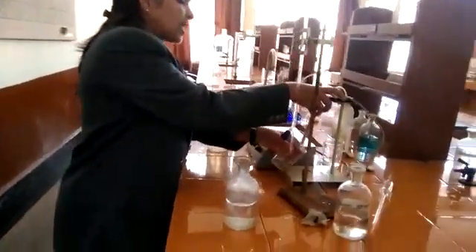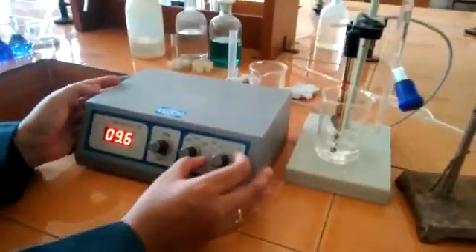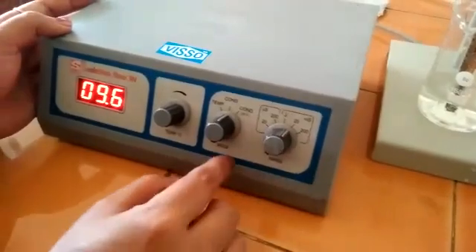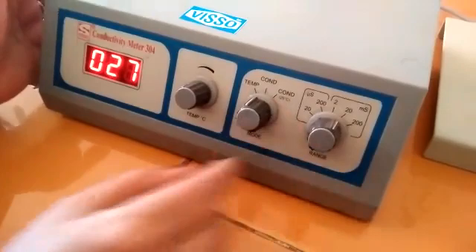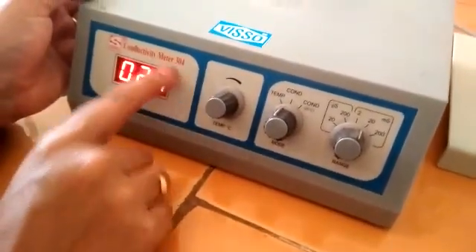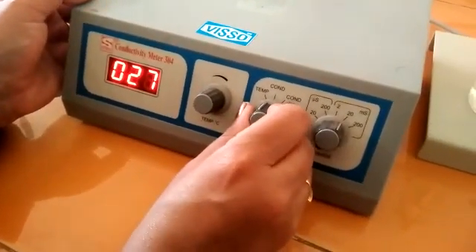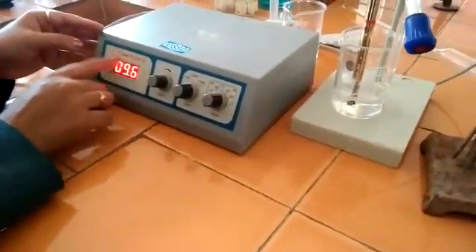After pipetting out, you have to dip the conductivity cell completely into the acid mixture and note down the initial reading. The conductivity range should be adjusted to 20 millisiemens. Adjust the temperature mode to the lab temperature — here it is 27°C, so we set it to 27. Then turn the knob to conductivity so that the conductivity of the solution is displayed.